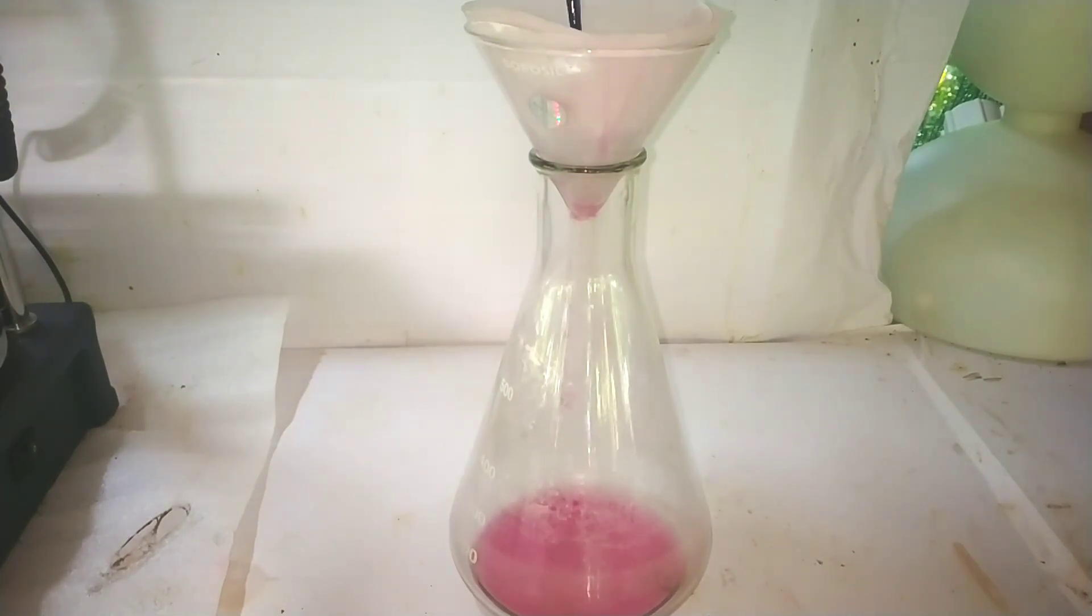Continue boiling for about one hour and then allow it to cool. After reaching room temperature, filter the solution to obtain the final product. I am using a gravity filtration method here.